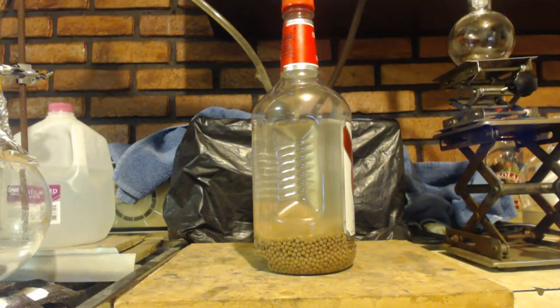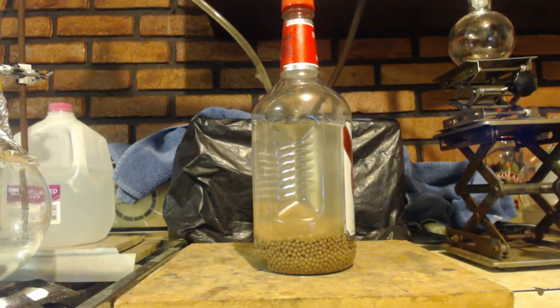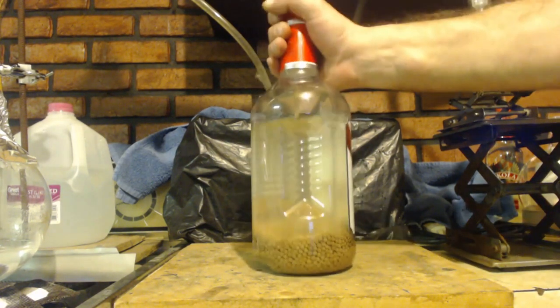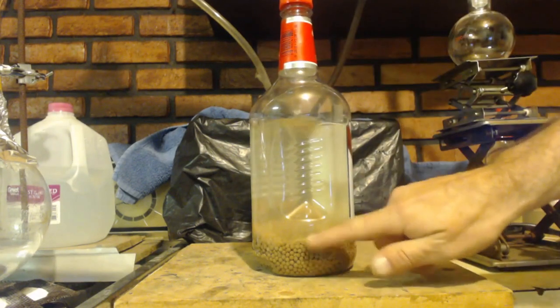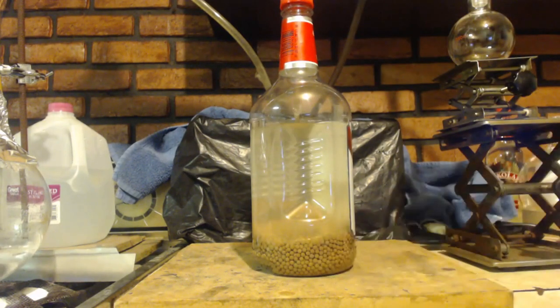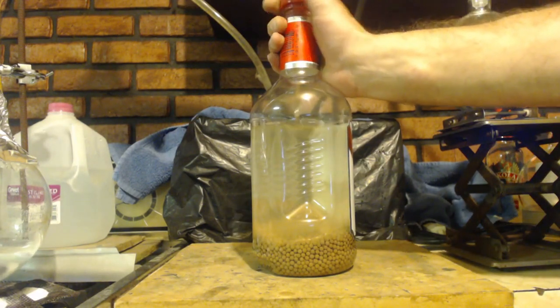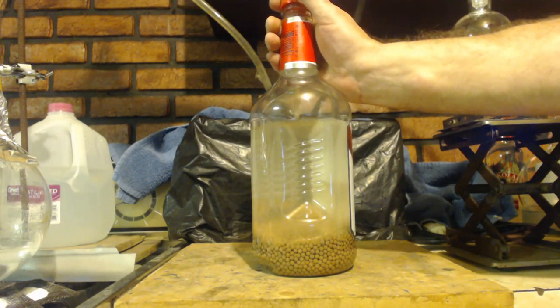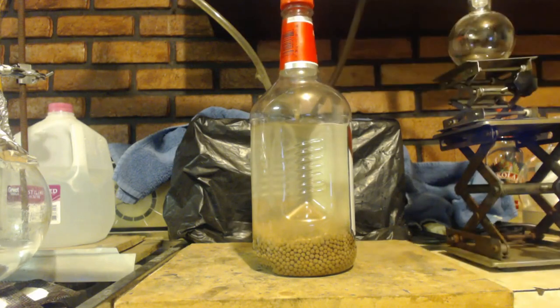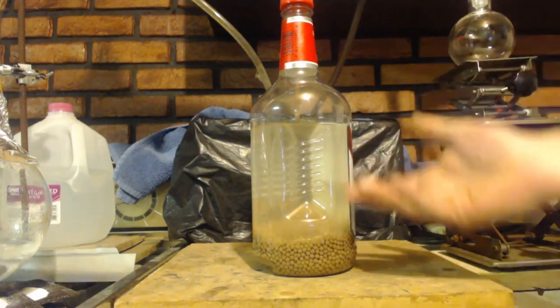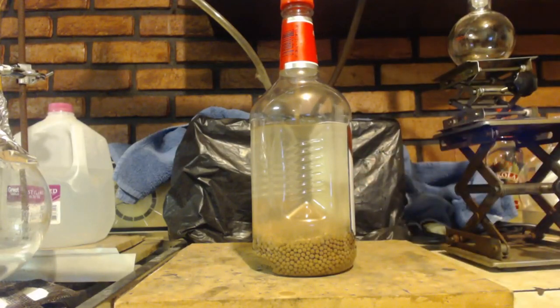I was just thinking, well, maybe since they were in plastic bags, they didn't absorb that much water. Apparently they absorb out water. So I regenerated it. As you've seen, I distilled some more vodka. I put the regenerated sieves in there. Now it's only been a day and it's almost anhydrous. Okay. So it does work. I just put in a little bit extra sieves.